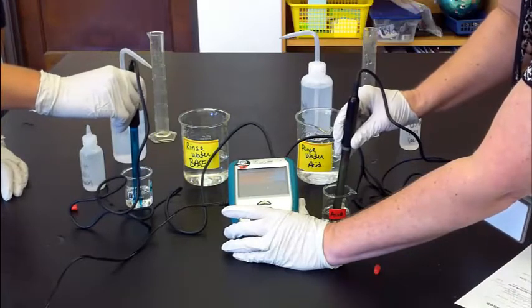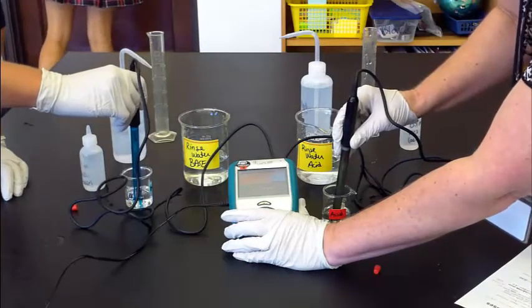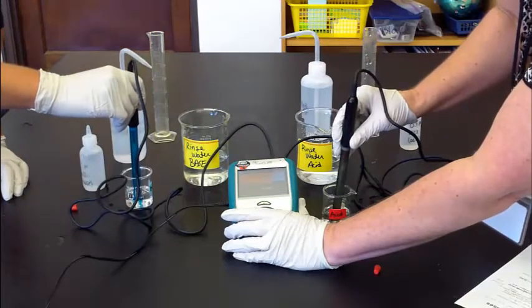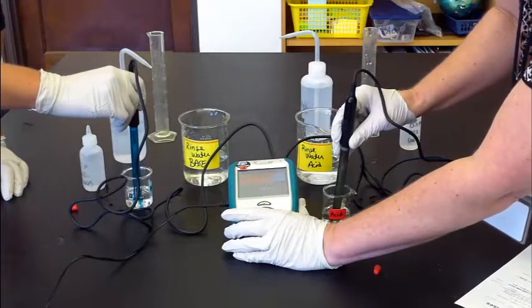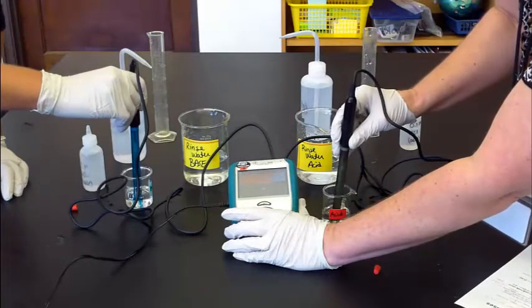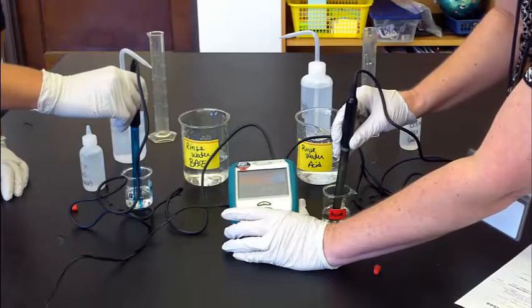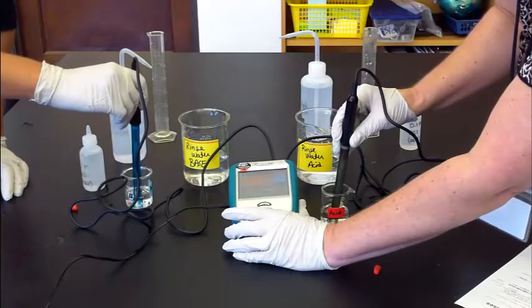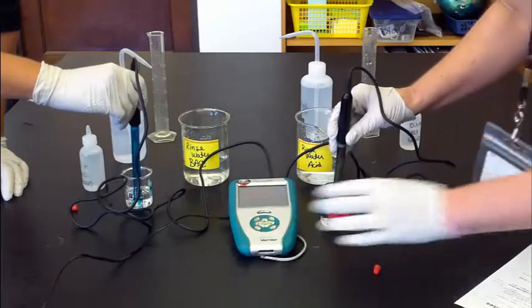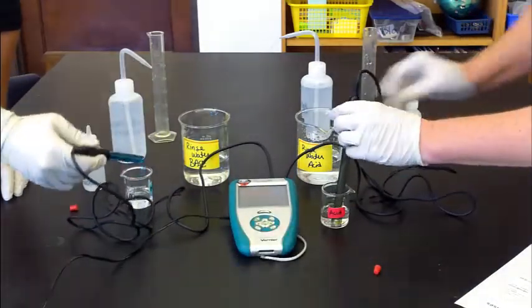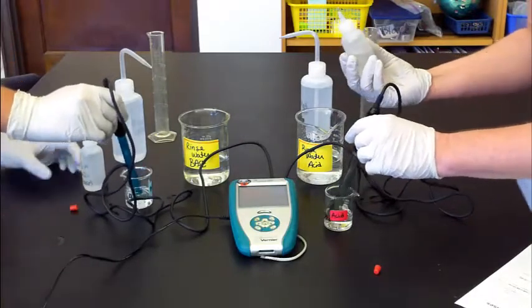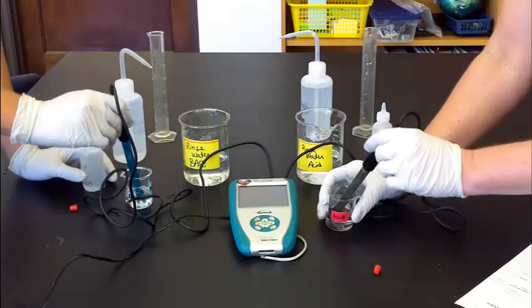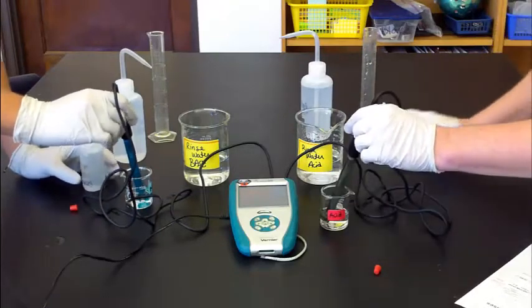The base is about 10.28. So it's nice having four people to do this: someone to hold the beaker and the probe. Do not let go of the probe—it will tip over because it's top-heavy. So always be holding on to it.